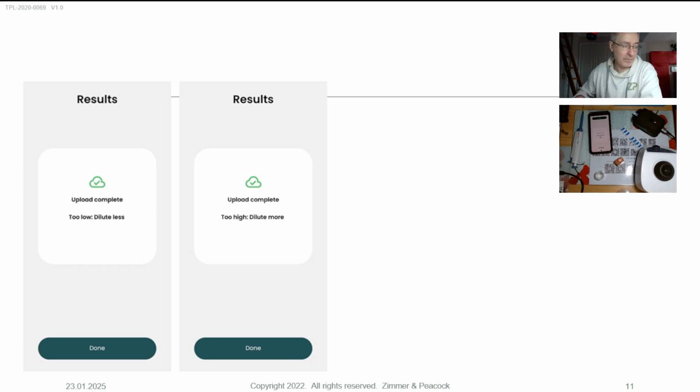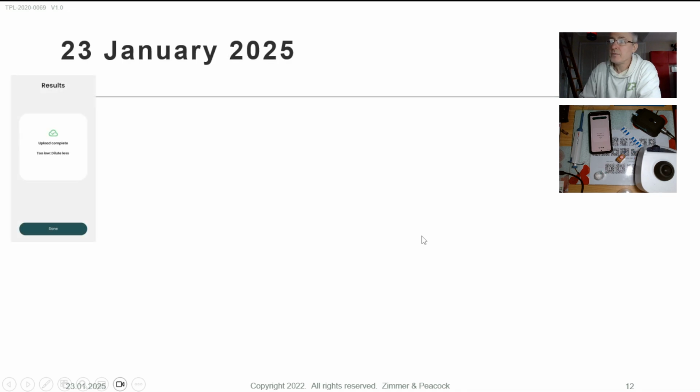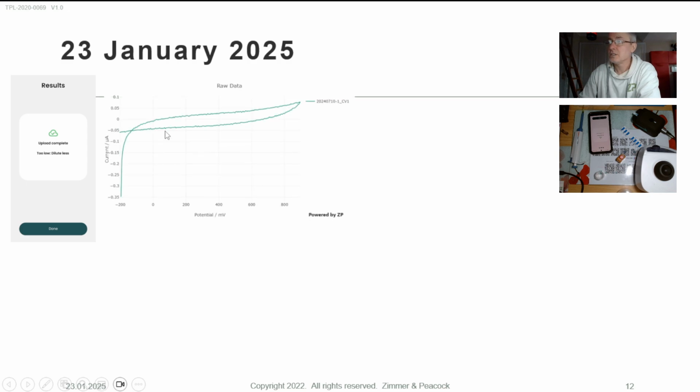It's probably worth saying that I have definitely done over 1,000 tests just myself on these kind of mild chilies. Every time I do a test, it gets saved in Djuli, so I can see that I've got a large database of tests. The good thing about FoodSense Generation 4 is it's extremely powerful, because every time a test is done, all the data is saved up to the cloud. So these people have what's called a Djuli premium account. They run their analysis, their sample, and the data goes to the cloud, and they were kind enough to share it with us. So I can see their data.